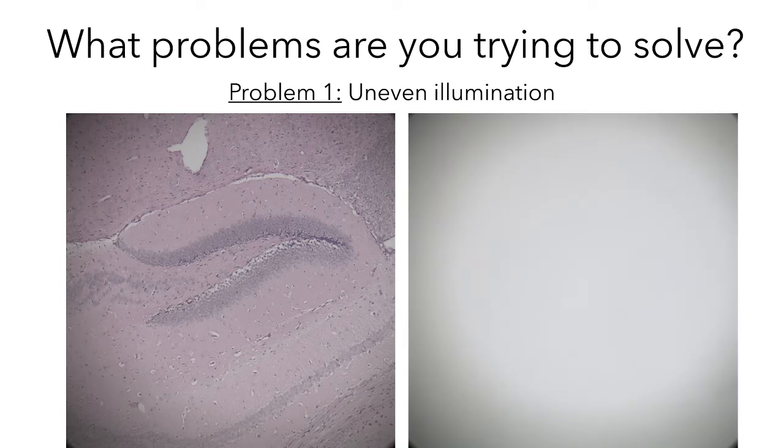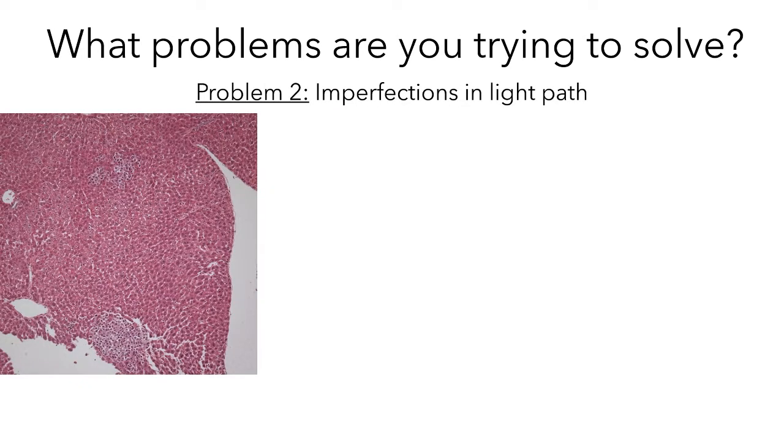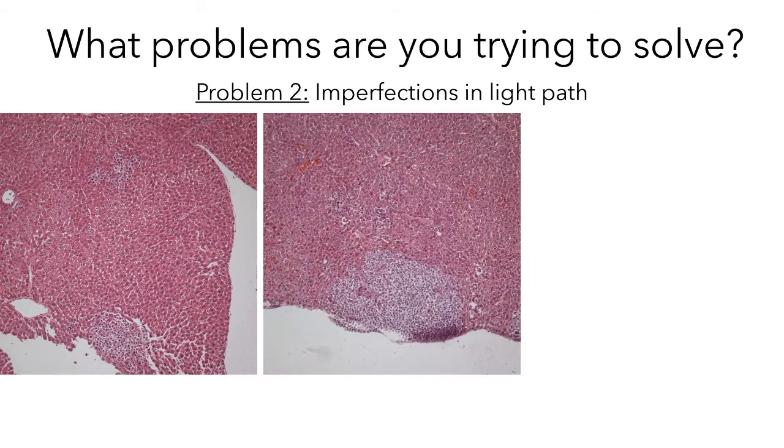So you can see that this is clearly an issue with the microscope. It has nothing to do with the sample. The second problem is that sometimes there are imperfections in the light path. So, for example, if you look at this image closely, you see what looks like debris here, here, and here. Some of these things might be debris from the sample itself. So if we go to a different region, they shouldn't be there. Here's a different region of the same sample, and yet you can still see some of the imperfections there. You can see in particular this blob here is present on both.